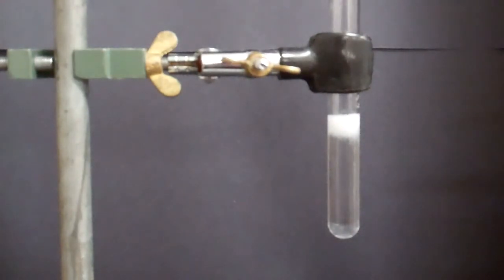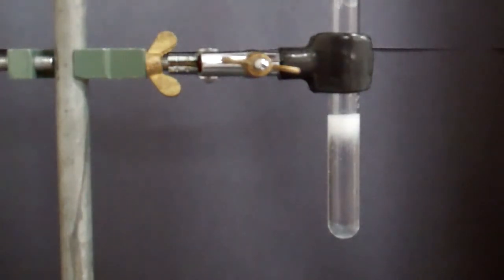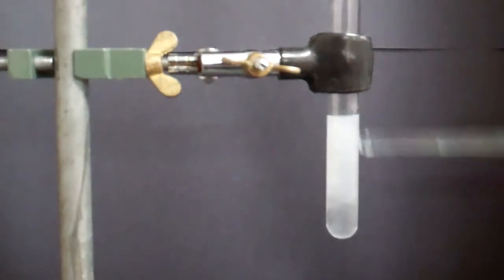Notice that with the lead test you also got a white precipitate, but it was different than this one. In the lead test you began to see immediately this snowfall with larger chunks. This one has smaller sized particles forming that white precipitate.